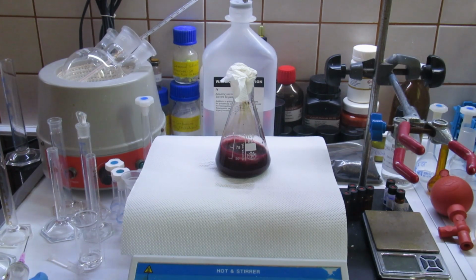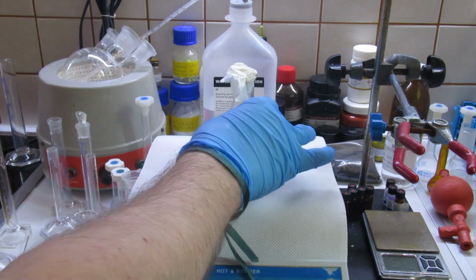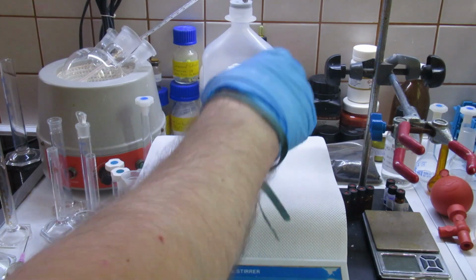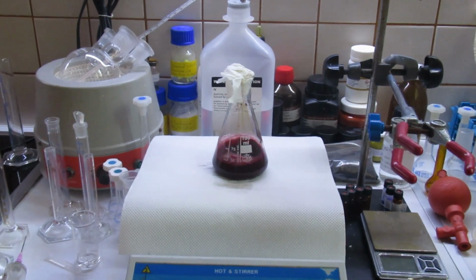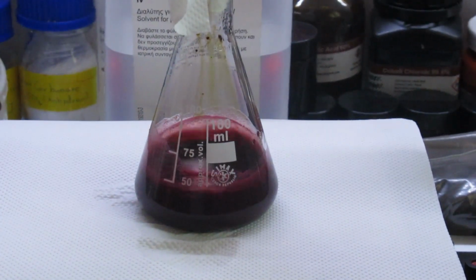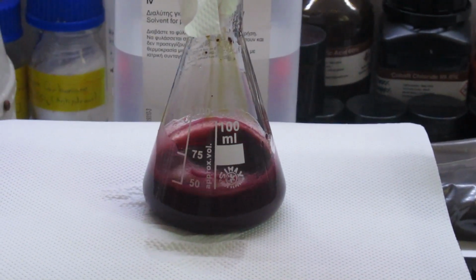And now I'm gonna pause here. As you can see already there's something going on, something is changing.